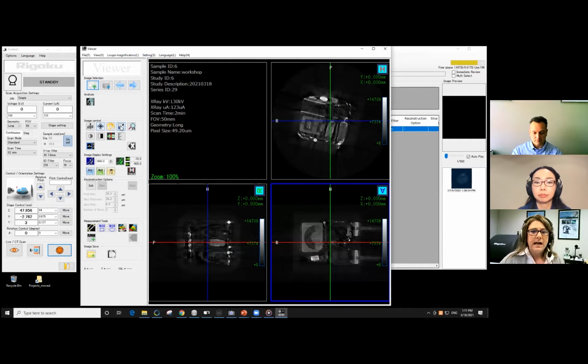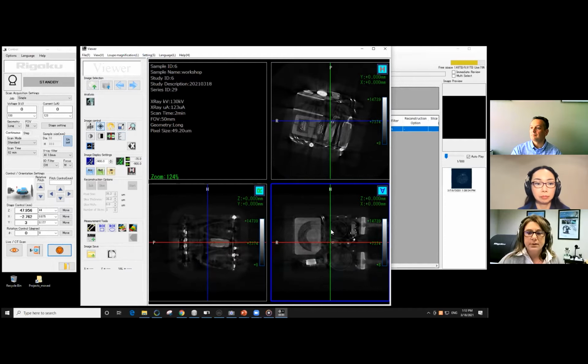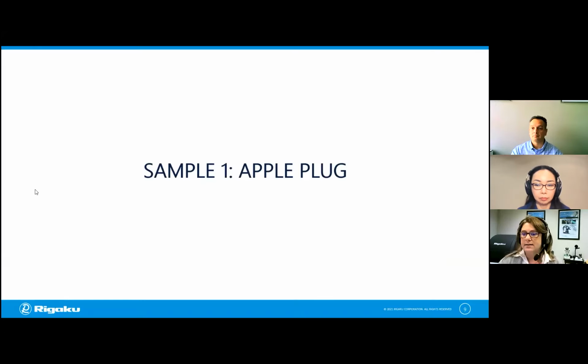So I can zoom in here and I can translate this over a little bit. And we definitely see some features happening within the X-ray image itself. For example, we see these streaks here. We don't see them so much around the metal parts, but for the metal parts that are inside, we're getting these what are called metal artifacts. And it turns out that for the purposes of this experiment, you did choose the correct condition, or the best condition of the ones that we gave you. But let's ask the question, what would it have looked like using something else?